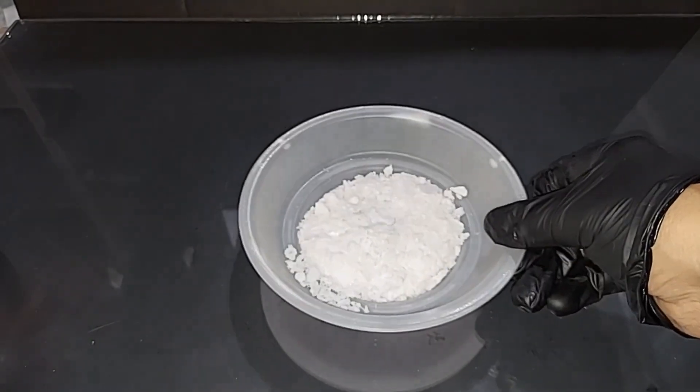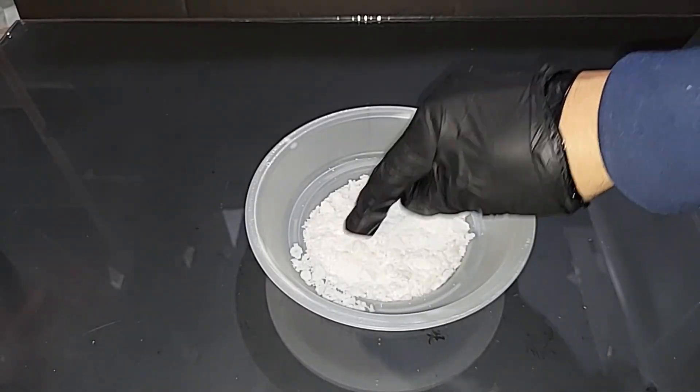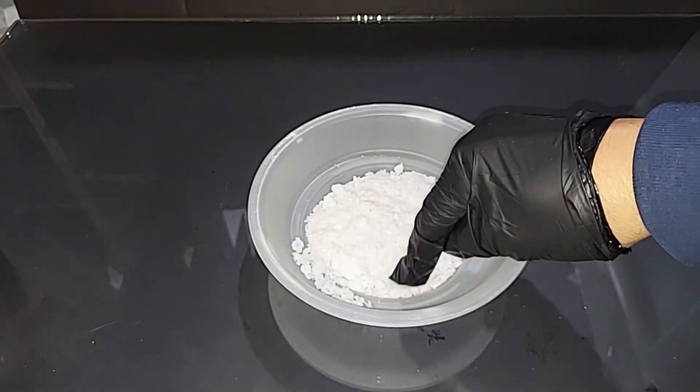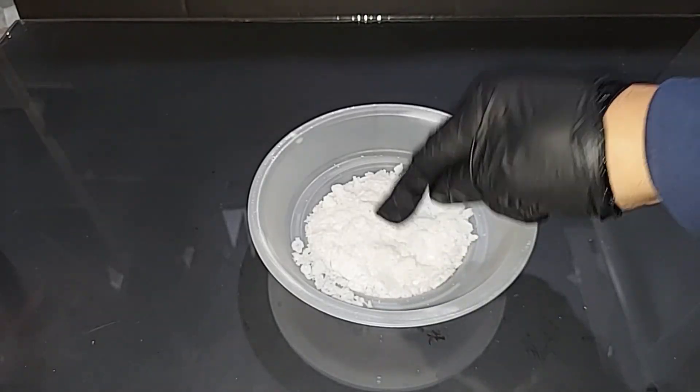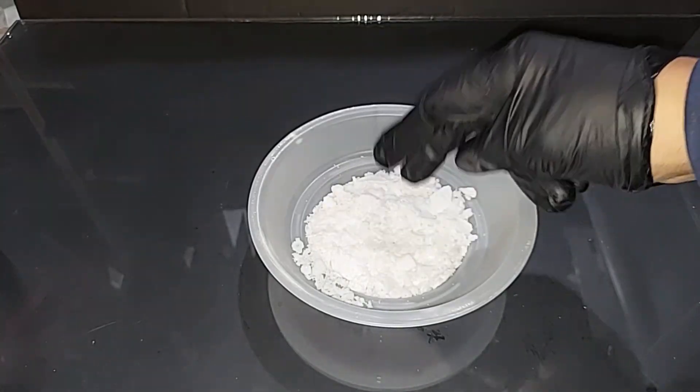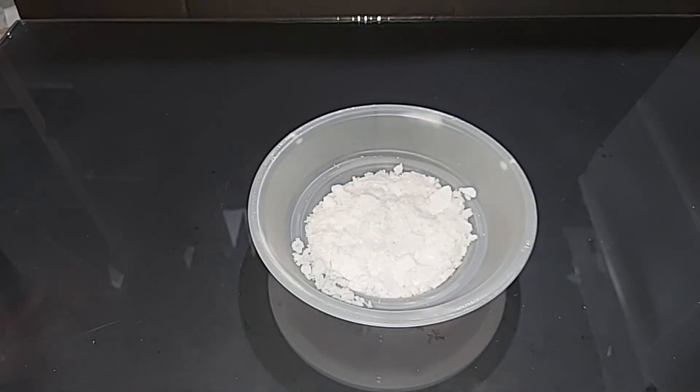Here's our ammonium sulfate finally. I would say to characterize it, it's a little bit like snow actually. It felt like that scraping it off. If you live in the south, sorry I don't have a way to characterize it for you down there, although the way the weather has been lately I think many of you've had snow so you know exactly what it's like. All right regardless of all that let's weigh it.